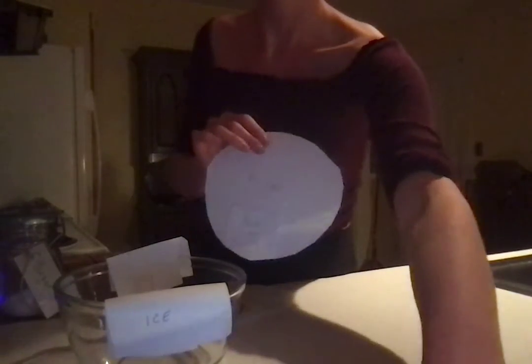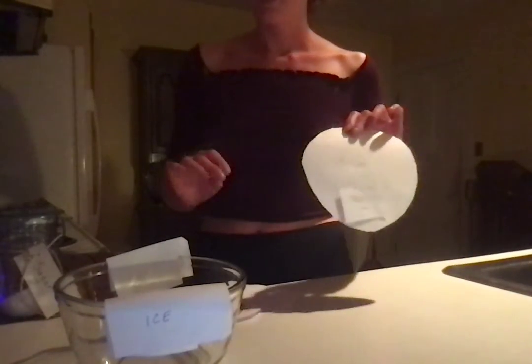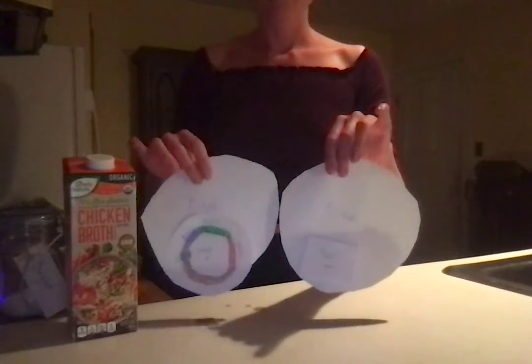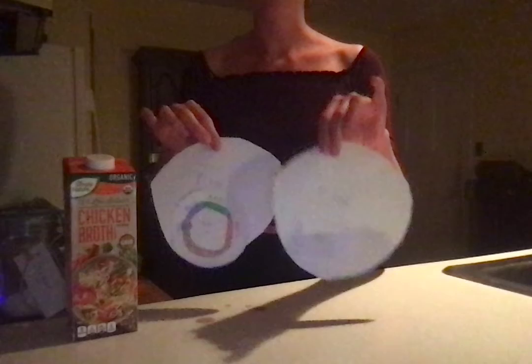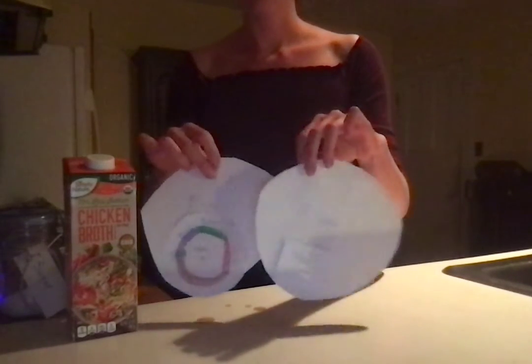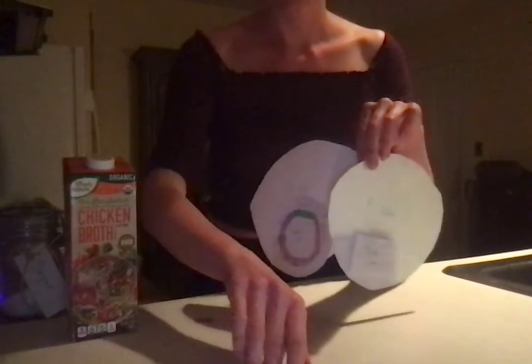And then next we want to place our culture in a culture with some media to see our growth. So we're going to use Luria broth for our media. So at this point, both of our samples will be growing until we add our ampicillin.